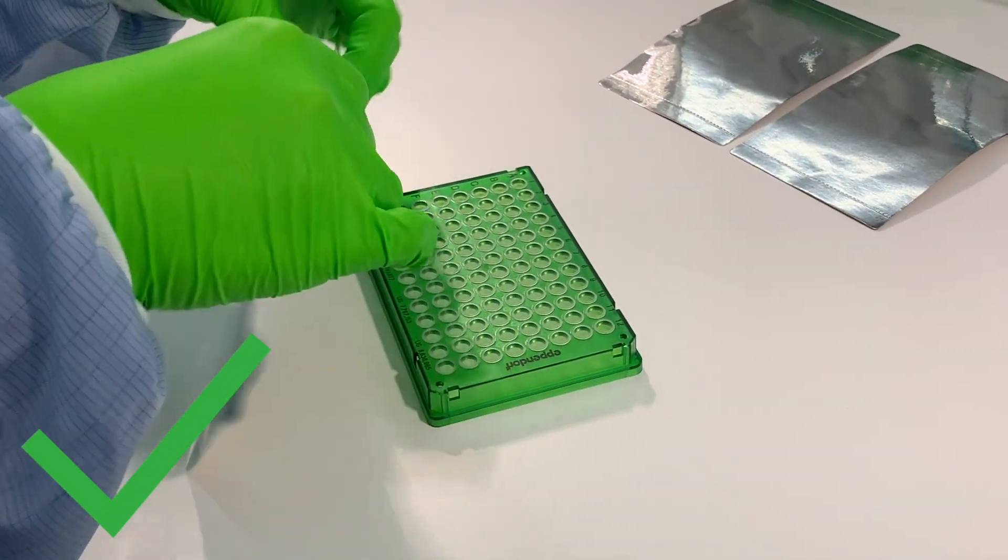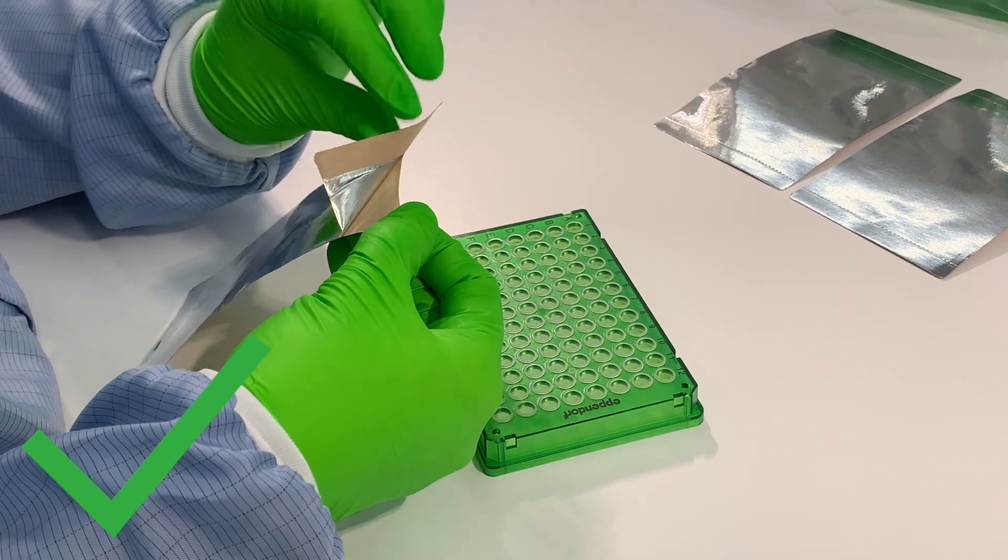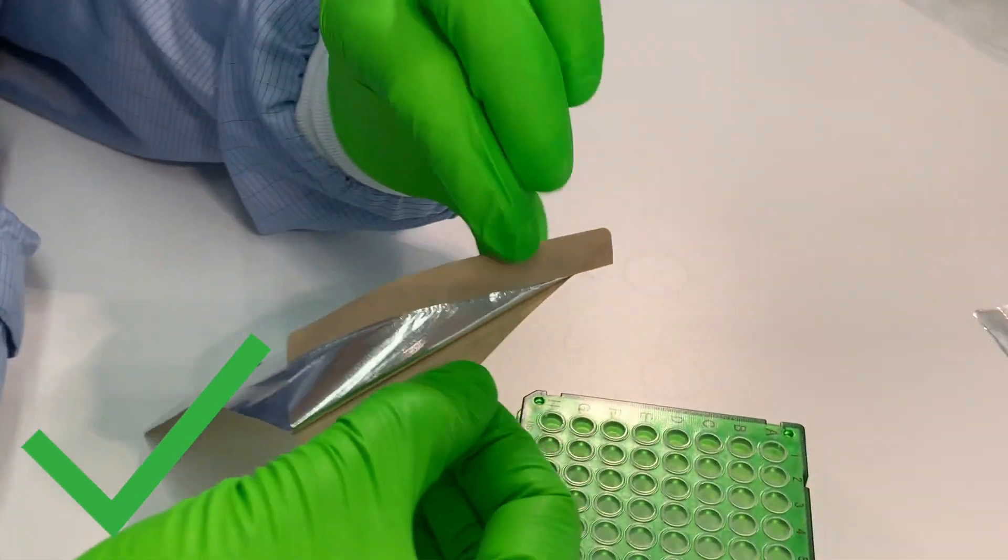Start by carefully pulling away the protective paper about two thirds, making sure you don't touch the sticky side.